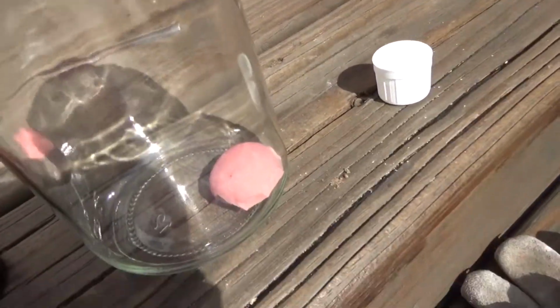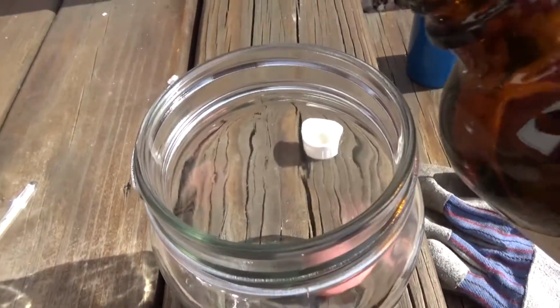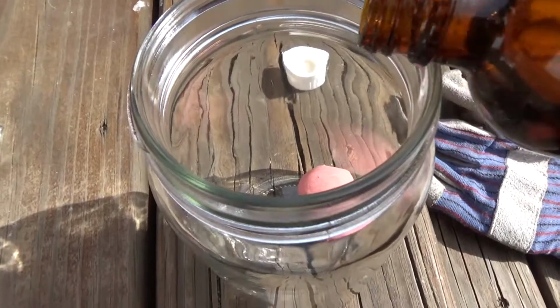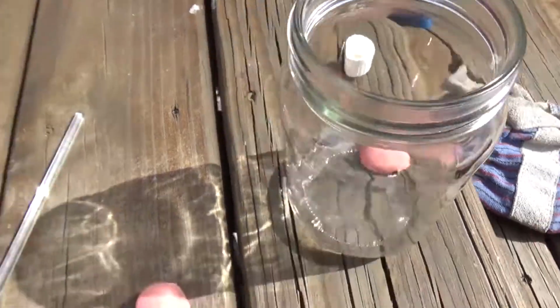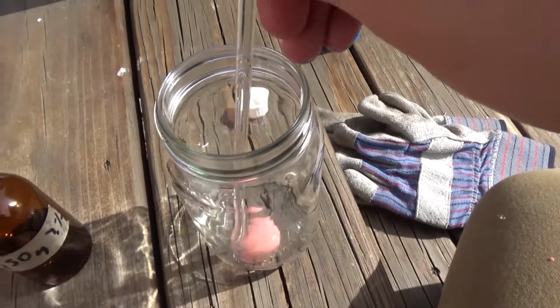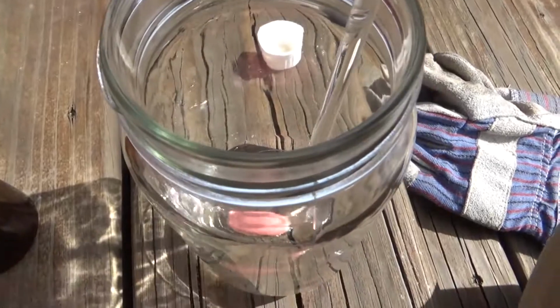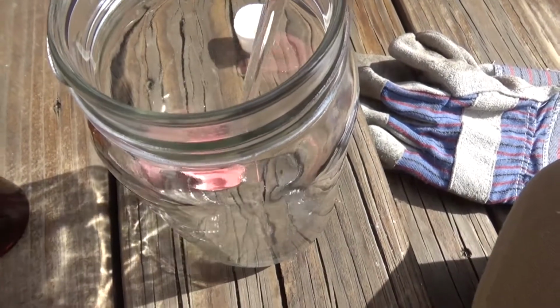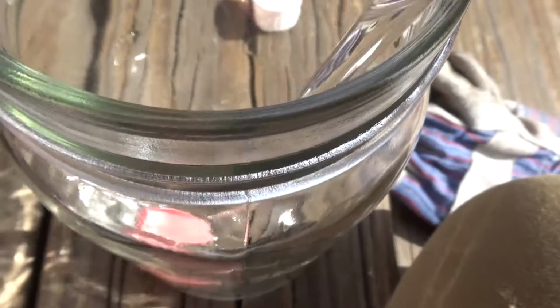Alright, there it is right in that jar there. Here's the acid, and I'm going to pour her in. So here we go. A bit of acid there. I won't pour in a lot, just enough to get the sides coated. I'm going to stir that up a bit. I'm not seeing any immediate reaction. Oh, wait a second. No, that's just the side where I cut. Okay, there is no immediate reaction.